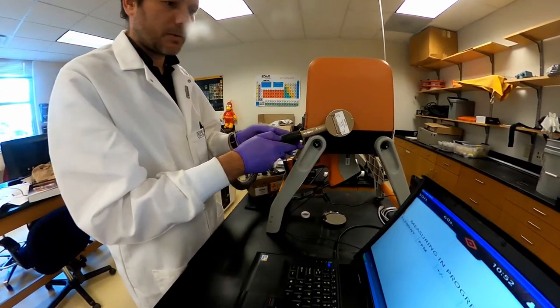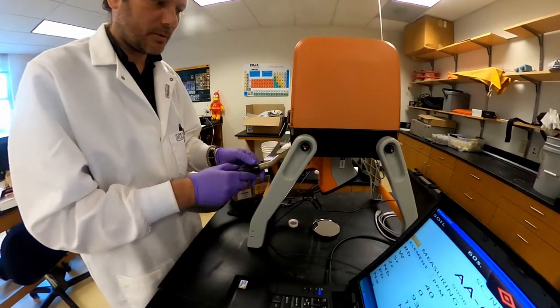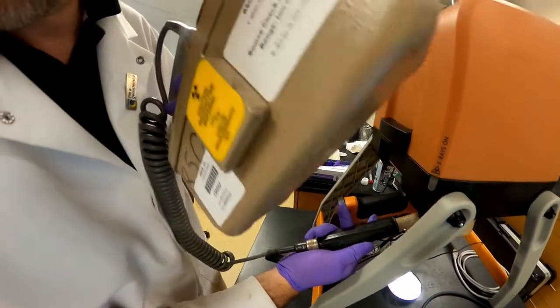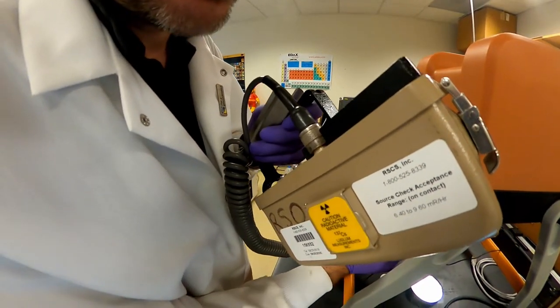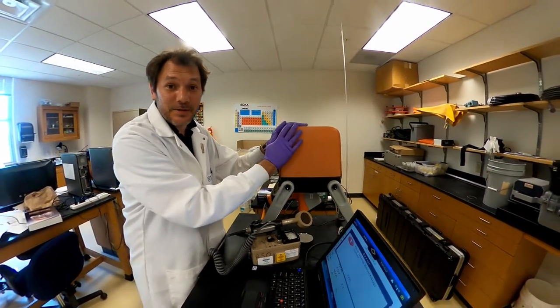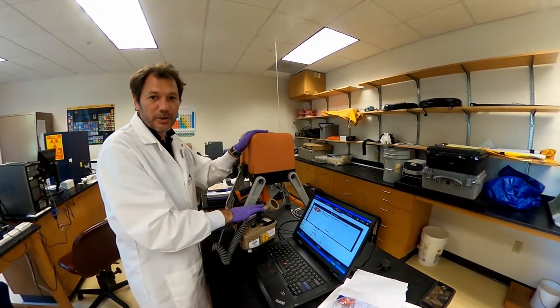It's a spectrum. Yeah, that's what I wanted to show. So, I found the only leakage was underneath. No, a tiny bit here. So, that's good. This lead shield actually protects extremely well from radiation. We have made the analysis with using the Geiger counter.